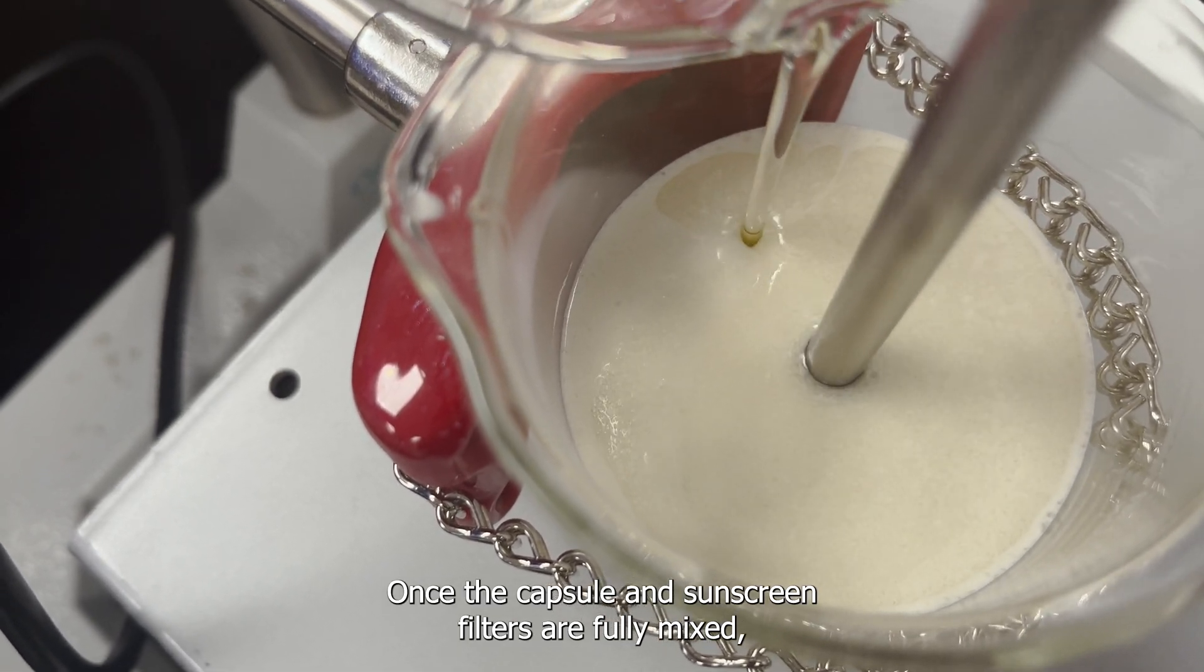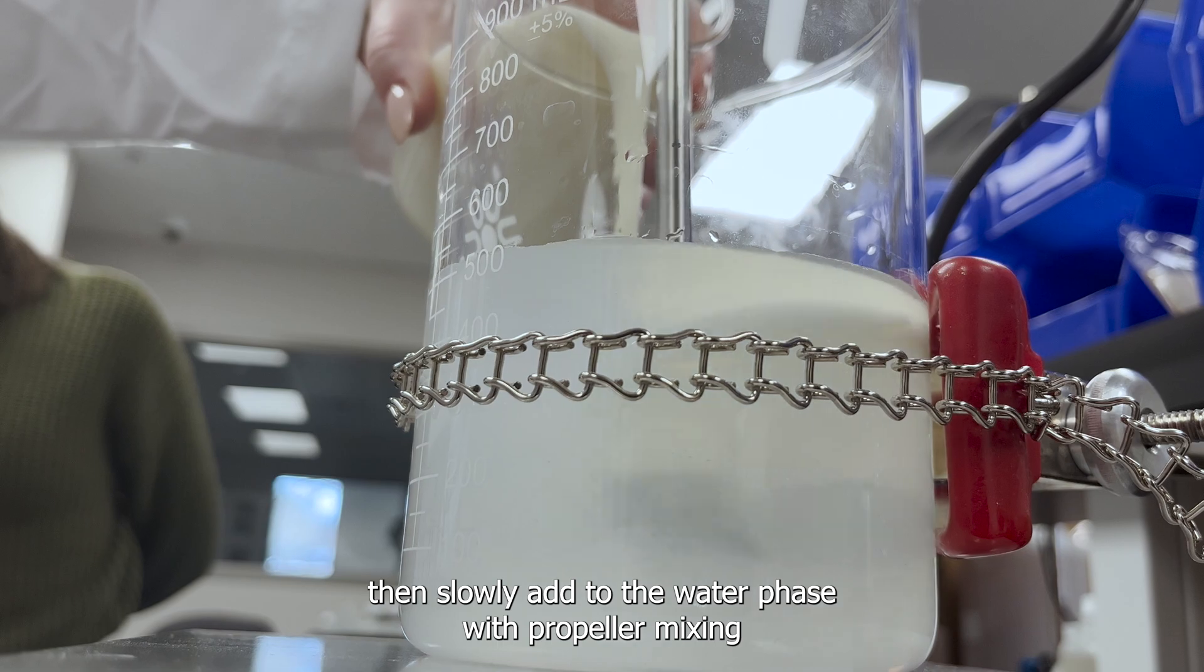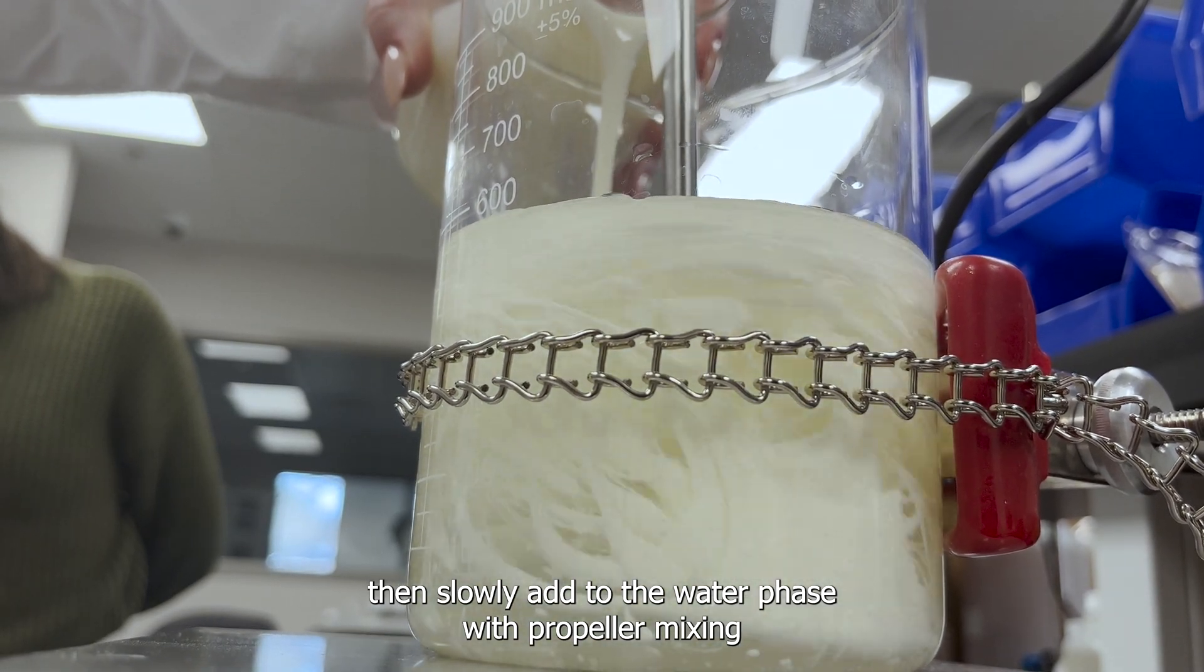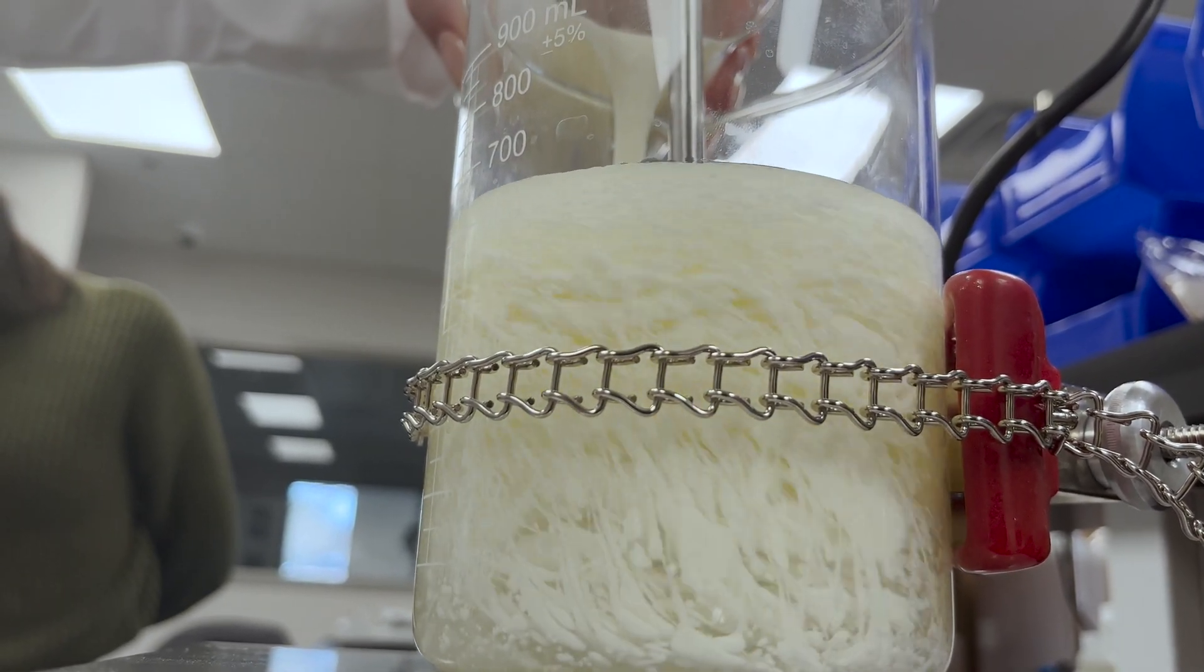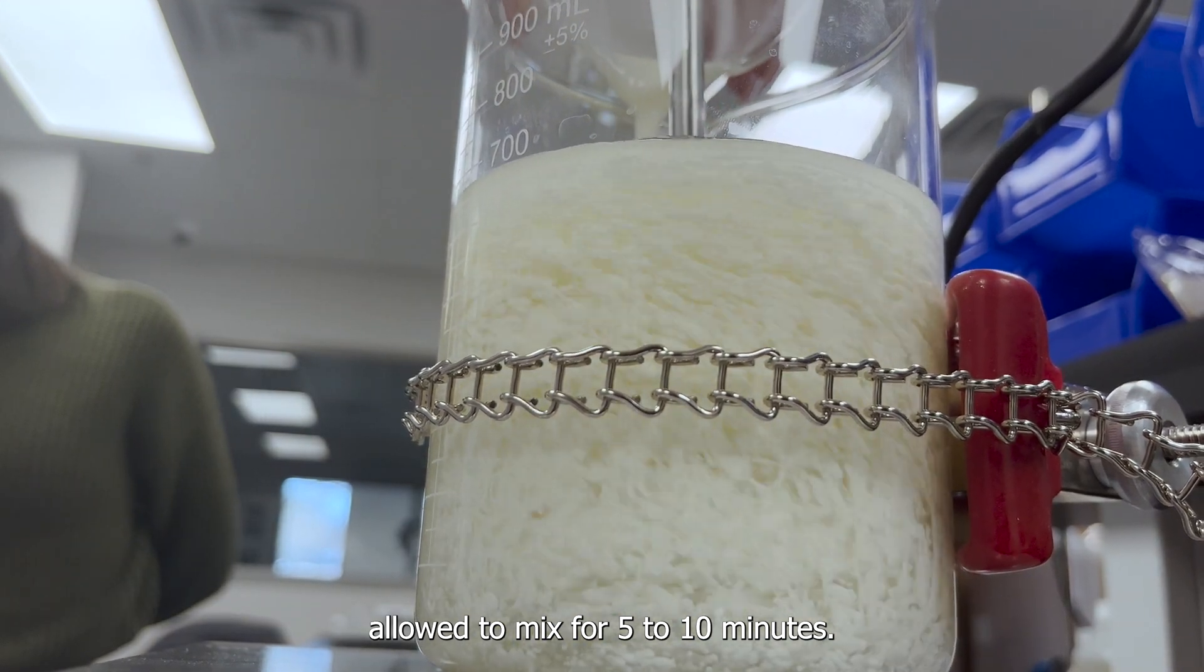Once the capsule and sunscreen filters are fully mixed, then slowly add to the water phase with propeller mixing. Allow to mix for 5 to 10 minutes.